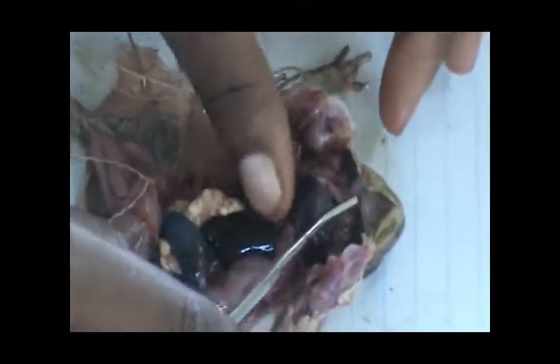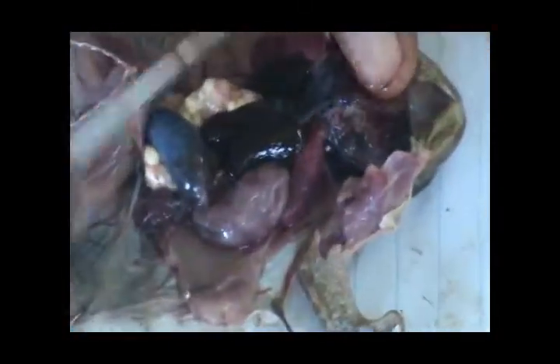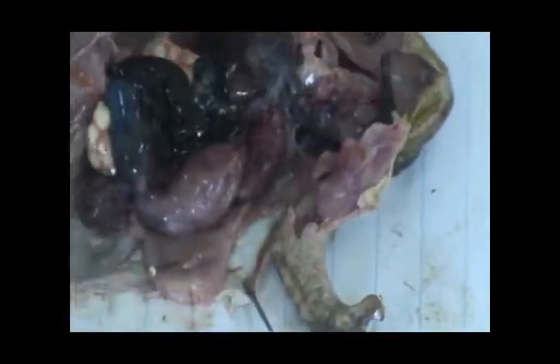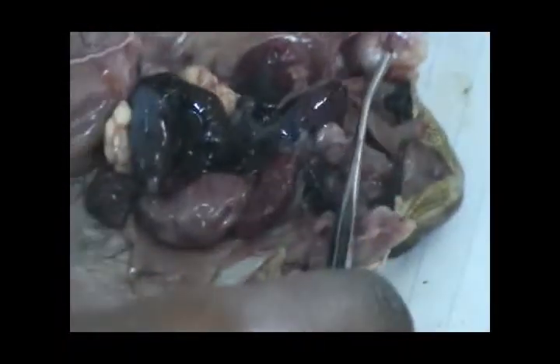When we displace the heart upward, that's when we'll be able to see the auricles and the ventricles properly. When we displace it upward, we are going to see the venous system. When the heart was still downwards it was the arterial system we were viewing. So when we displace it upward, we are able to see the venous system — the veins.